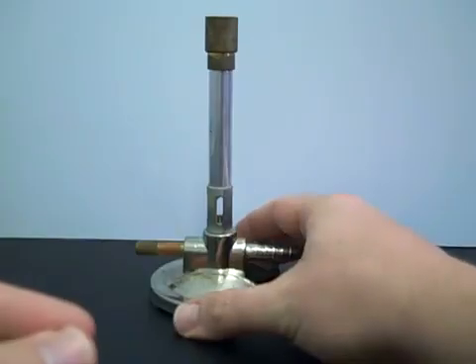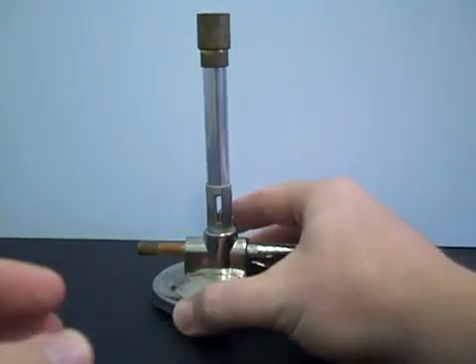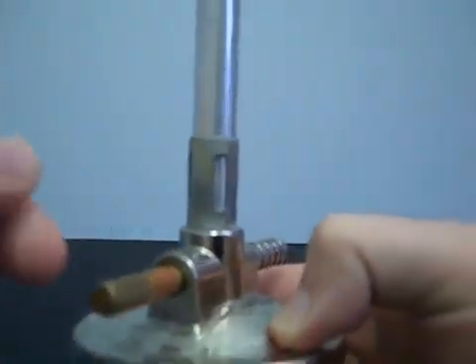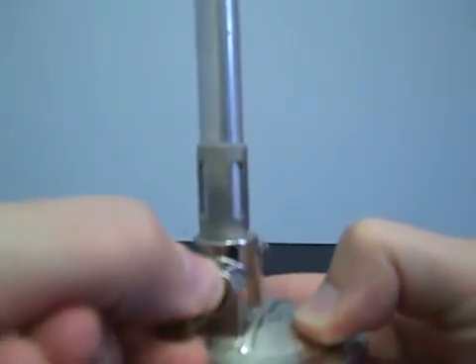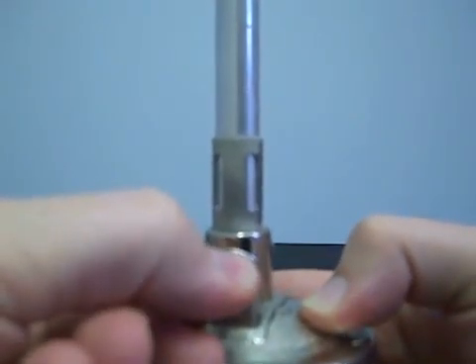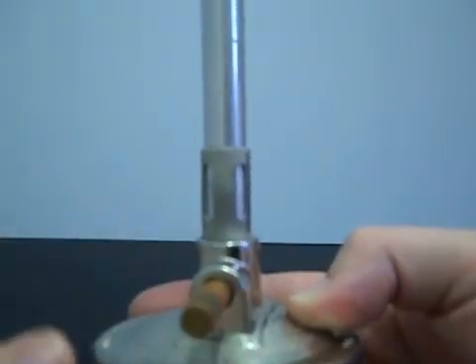Before you light a Bunsen burner, you should always set your air vents and your needle valve. The air vents should be closed totally. For the needle valve, start by closing it fully — remember: righty tighty, lefty loosey. Turn it clockwise and tighten it finger tight until it's closed. Then back it open by turning it counterclockwise about two half twists.